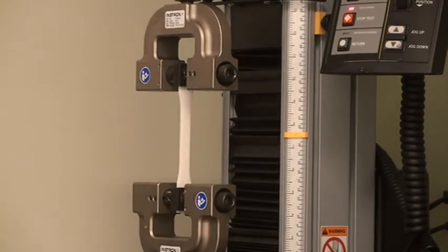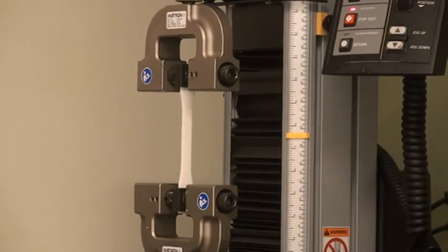You can now add a tare load, make any necessary measurements, double check your safety stops and put up the safety shield, and you're ready to start testing.